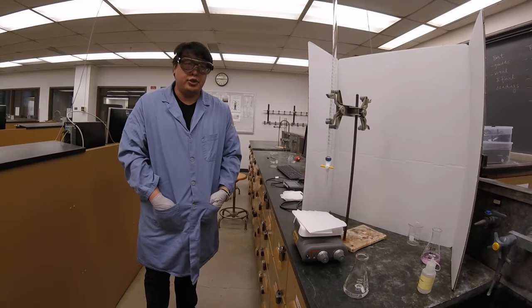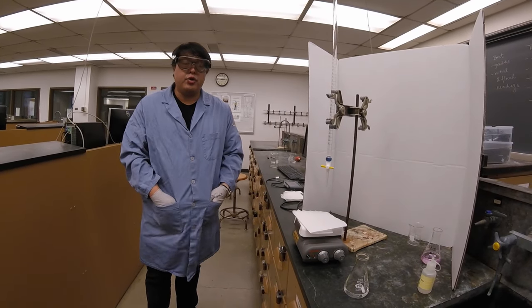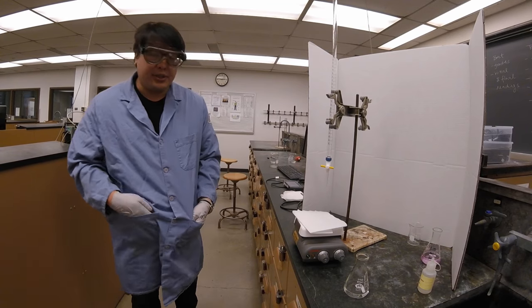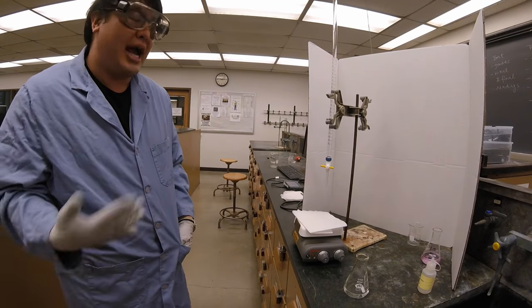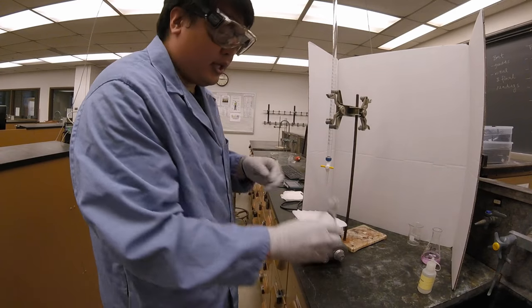It's important when you do this titration to know where you're going to slow down, hence the point of the scout titration. I'll talk about that more as we get there. So here is our second titration. Right now, the acid is already inside, but I have not added the indicator yet.